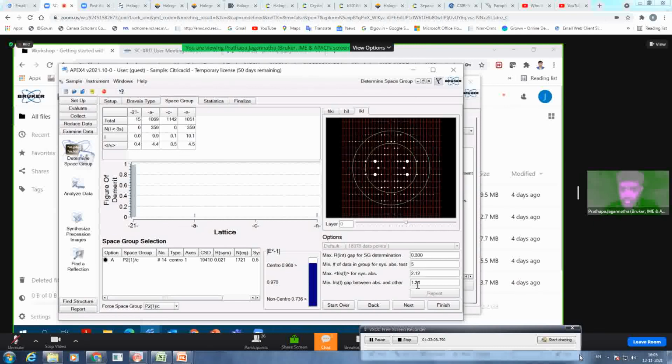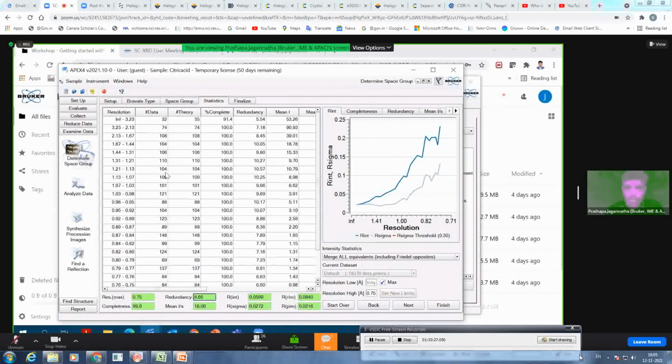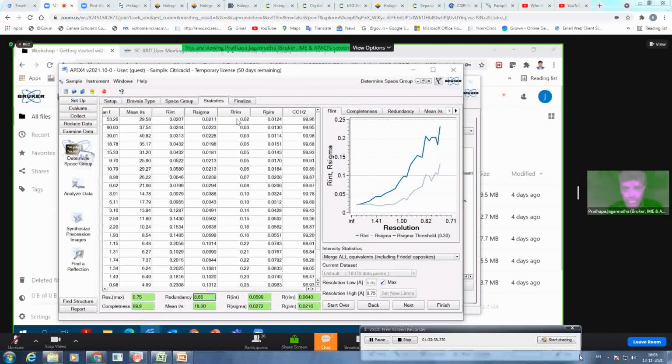And then you can also reduce your threshold to find if there is any other space group possible or not. But based on this symmetry, it is suggesting only one space group, and the combined figure of merit is also quite good. Click on next, you get the intensity statistics. If you are a number person, you can see the numbers. If you are a graph person, you can see the graphs here. And along with R int and R sigma, which were given in Apex 3, now in Apex 4, you can also look at R rim, R pim, and CC half as well.